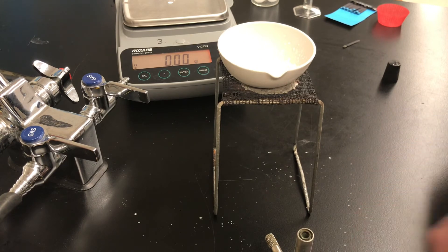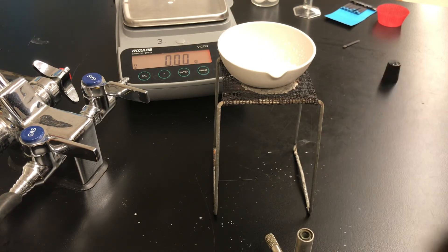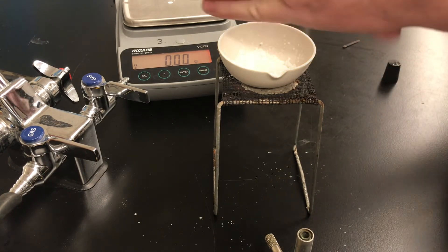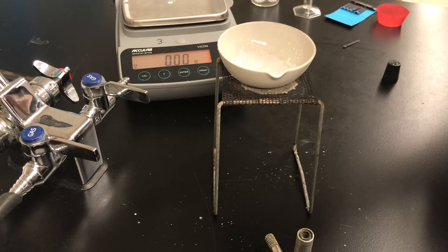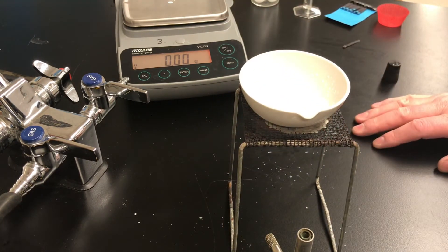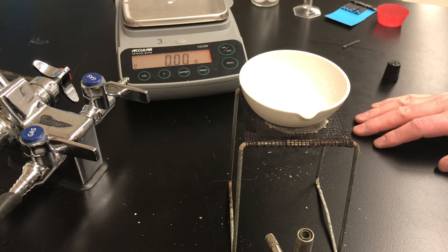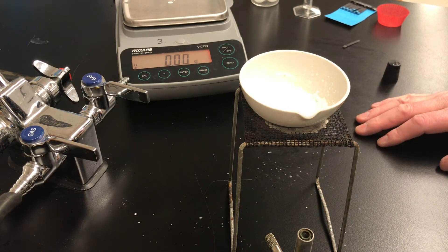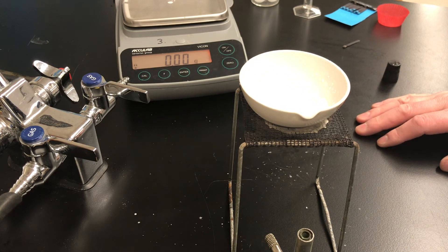I'm going to put that salt back in the dish to minimize the error. Some salt definitely escaped but I'm pretty confident that what's left in the dish is now dry. So I'm going to wait for it to cool. I'm going to pause the video and then we'll come back and mass it again.